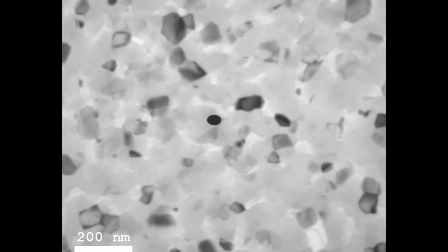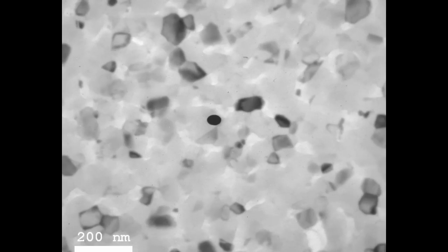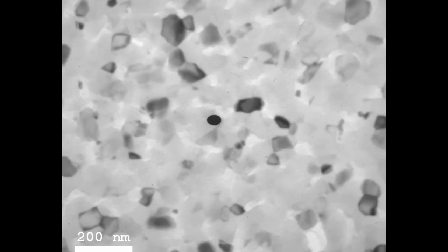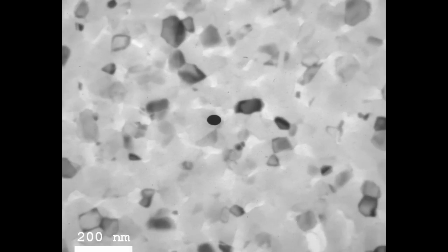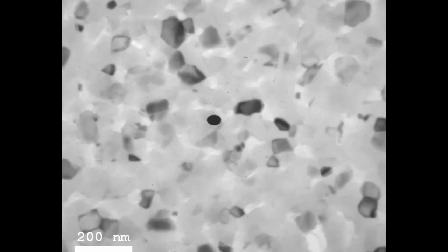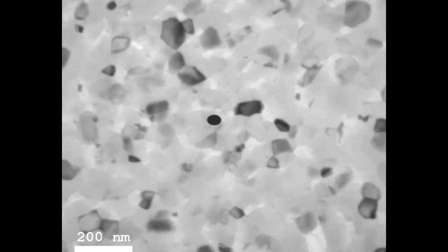Now I will show you a microscope image. Here is the bright field imaging view of the TEM, showing a sputtered aluminum sample — everything on screen is aluminum of equal thickness. The contrast we see in these small grains comes from aluminum crystals oriented in different directions. The objective aperture in the back focal plane has been used to block out deflected electrons satisfying the Bragg condition, which is why some regions appear black — that's what makes the individual grains visible.